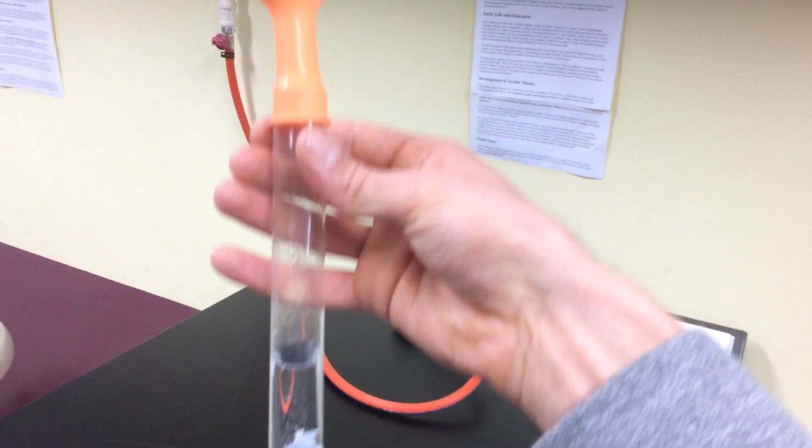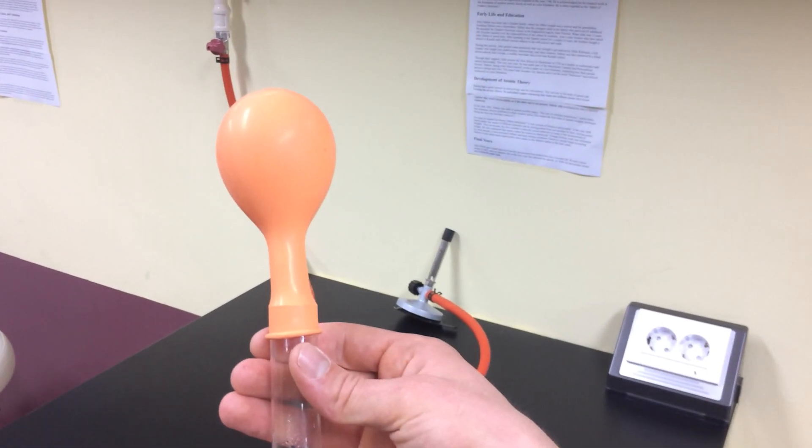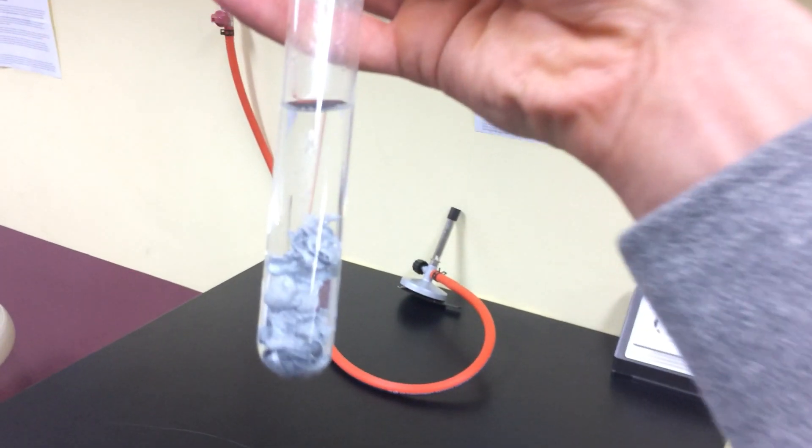So here you have a cool reaction. Zinc and hydrochloric acid produces this hydrogen gas as a product.